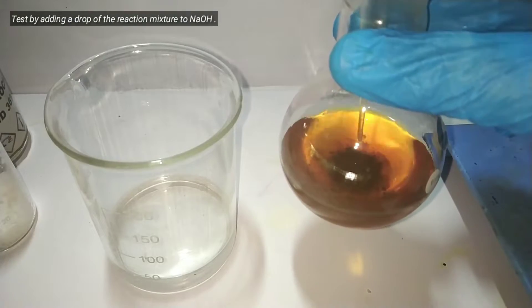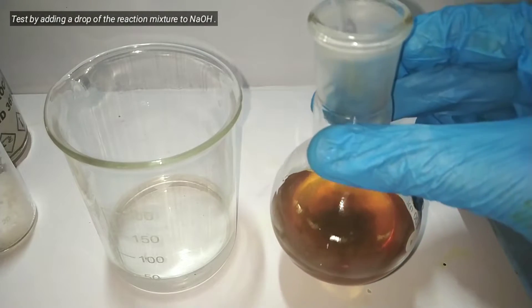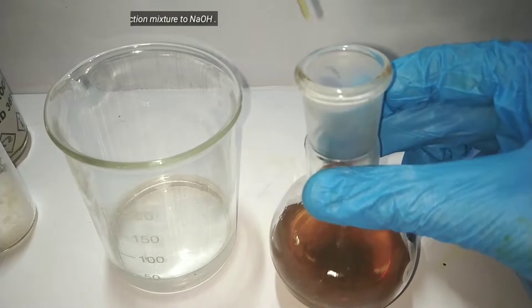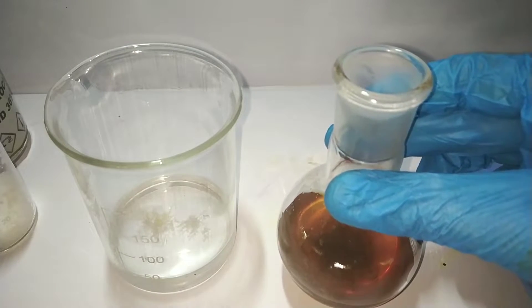The reaction is said to be complete when a drop of the reaction mixture dissolves in sodium hydroxide, which in my case wasn't very obvious.